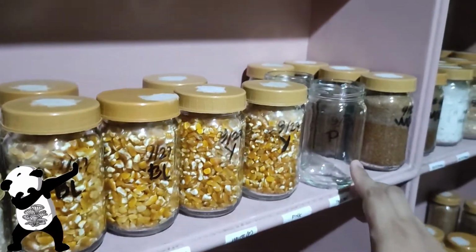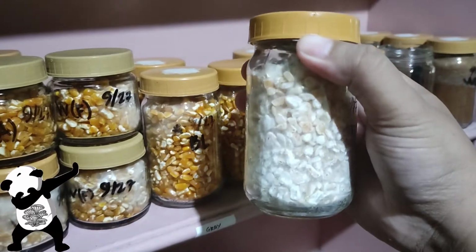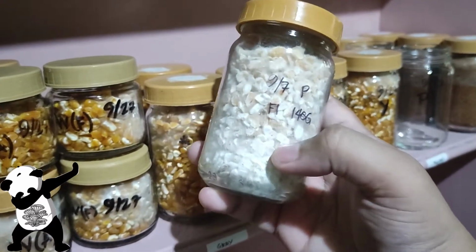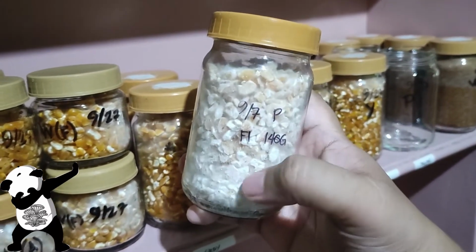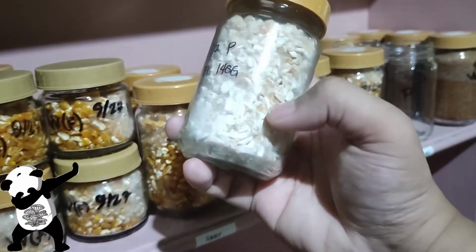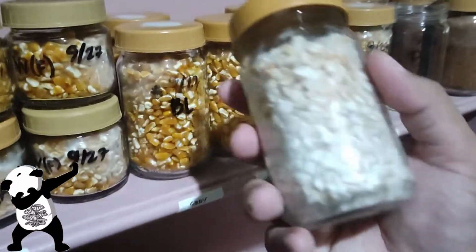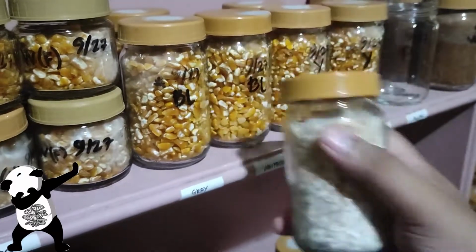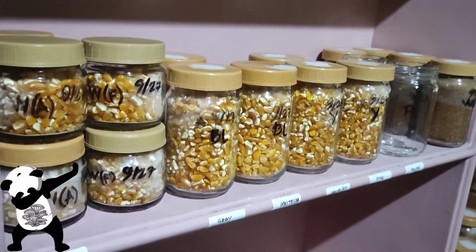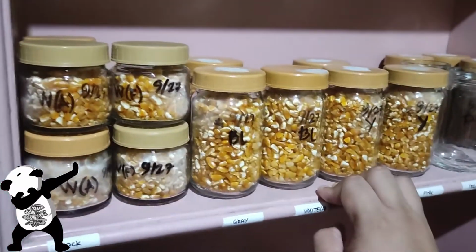And for the pink oyster mushroom, when they mature, they create pink pigments on the mycelium. I don't know if it's visible on the video, but here on this part, there are pink pigments already forming. That also shows that this mycelium is a pink oyster. I inoculated this on September 7, and today is October 6 or 7, the first week of October. So that's going to be our update for these grains.